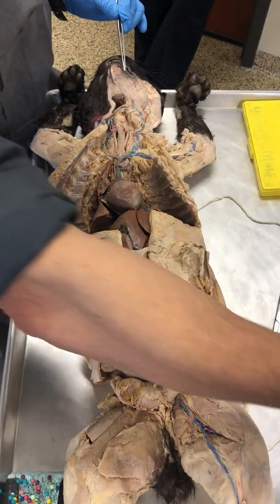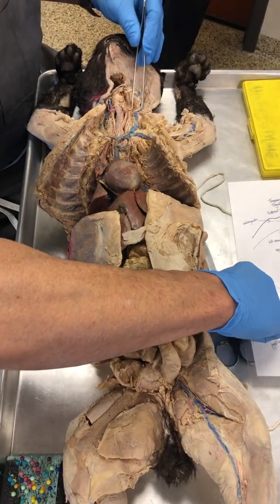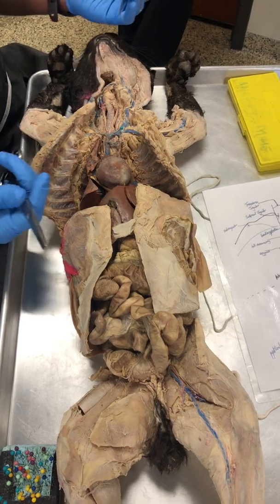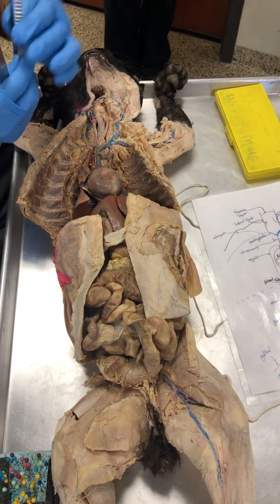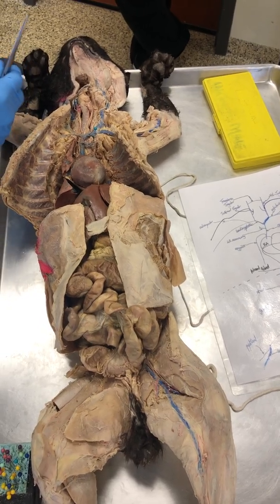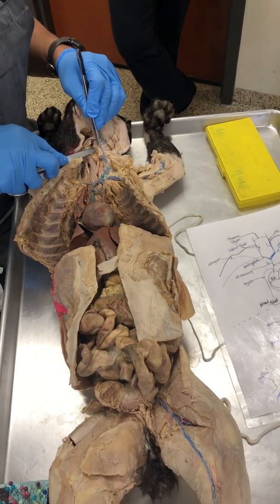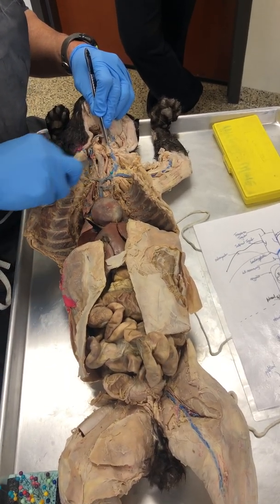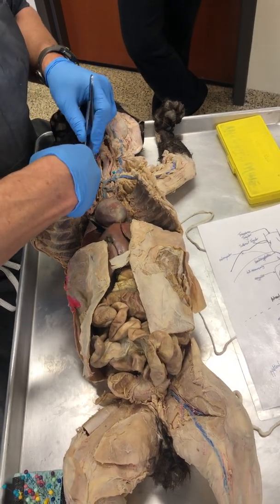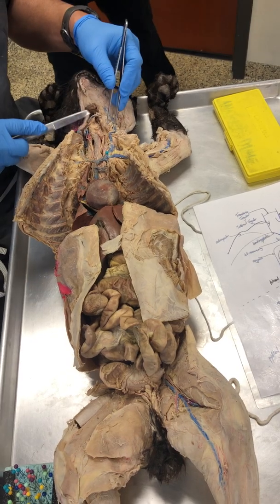Right? So this big one that is coming from the neck area right there, this one is the external jugular. So we can't just call it the jugular. So this vein that we see here at times, folks, that is the external jugular. We call it the jugular, but it's external. So there is the external jugular right there. So there's the right one, the left one, sorry, here's the right one right here. So there's the jugular right there. That's the external jugular.